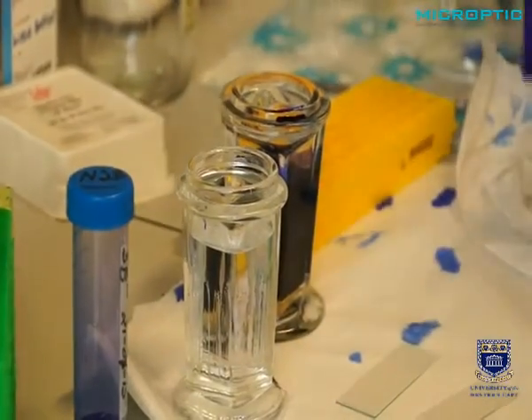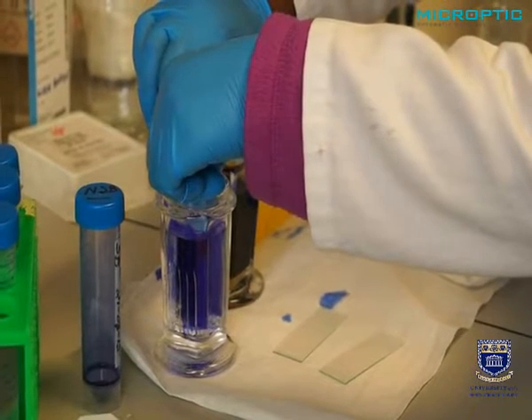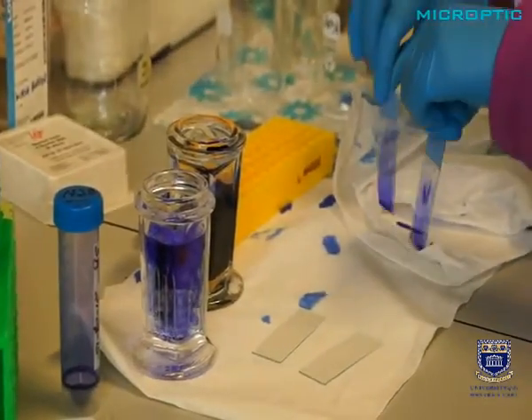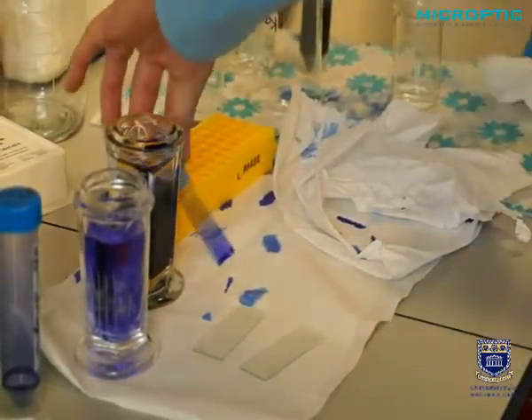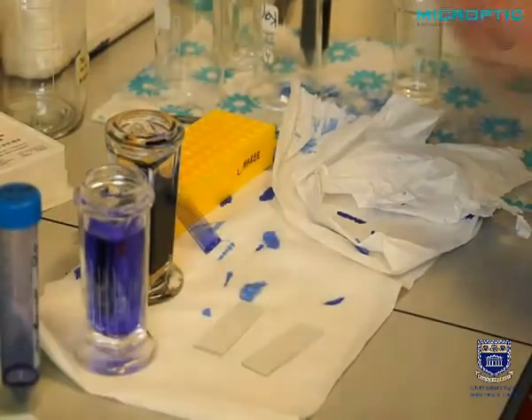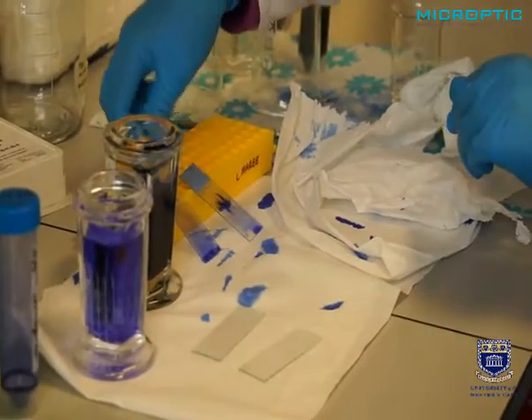drip dry them on filter paper, and now you can insert it in distilled water for 1, 2, 3, 4, 5, 6 seconds. Slowly pull them out and you can lean it against there, and that is fine. We can normally just take off most of the stain also at the tip, and also clean the back of the slide. This is really important. Lots of people do not take care to clean the back of the slide.